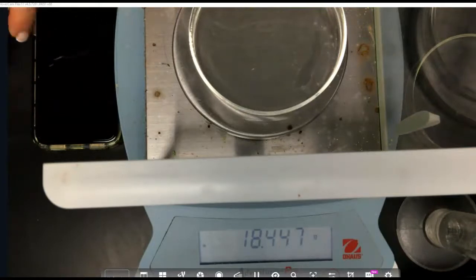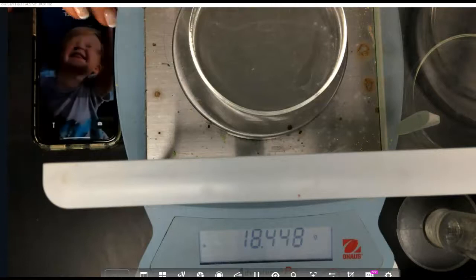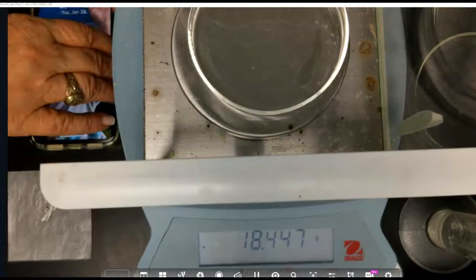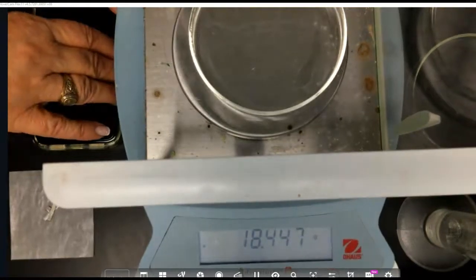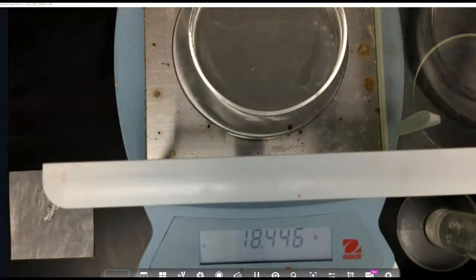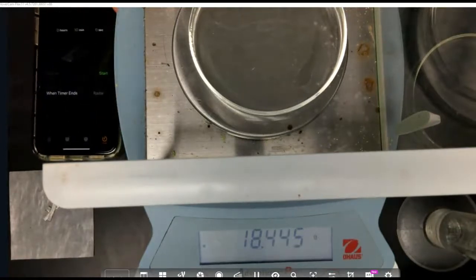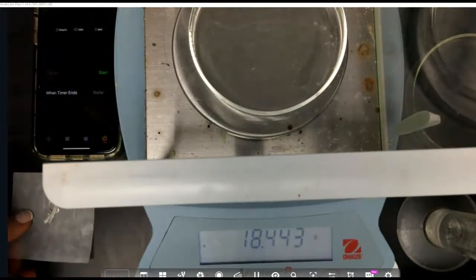So I have hydrochloric acid reacting with magnesium, and it's going to make magnesium chloride, as you know, and some hydrogen gas. And so that means that when we do all of this, we are going to be creating a gas, and as a result, the gas is going to produce a mass change because we're letting the gas be released into the air. So what we're going to see is a mass change as a result.